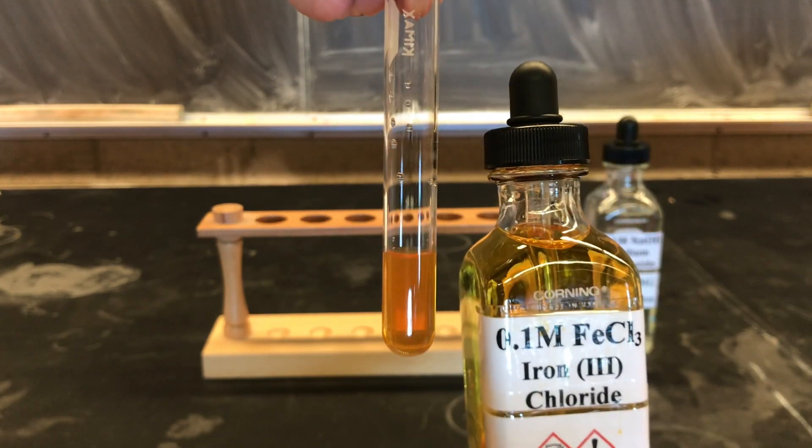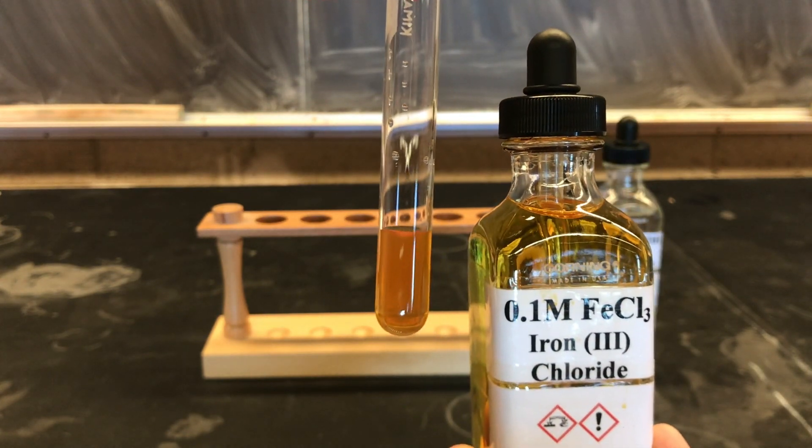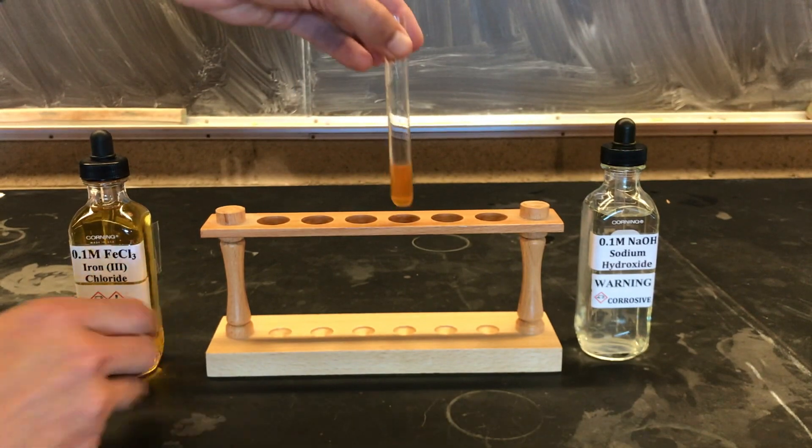After making your observations, please dispose of the waste in the labeled container and wash the test tube.